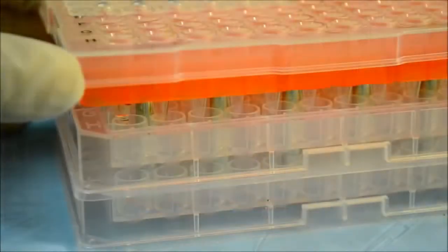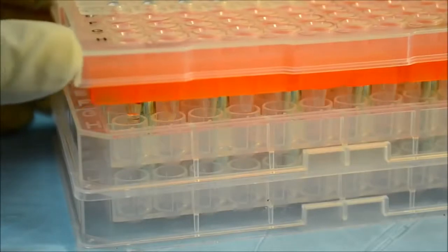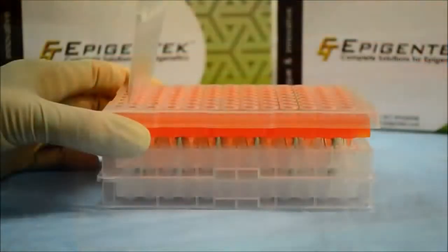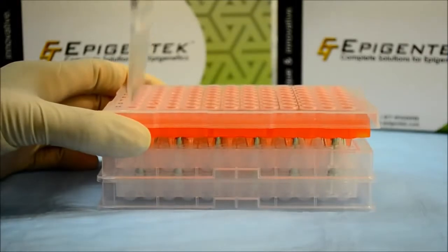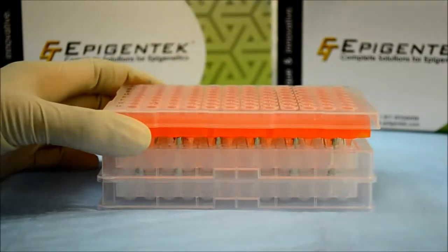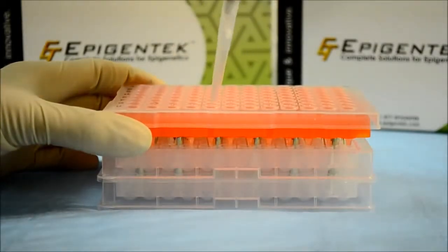When using a PCR plate, gently slide the adapter to the right for maximum exposure to the magnetic rods. After the solution has been cleared, pipette the odd numbered rows. Depending on bead type and solution volume, the attraction process can be as fast as several seconds.